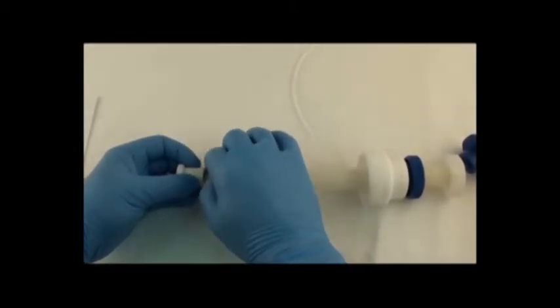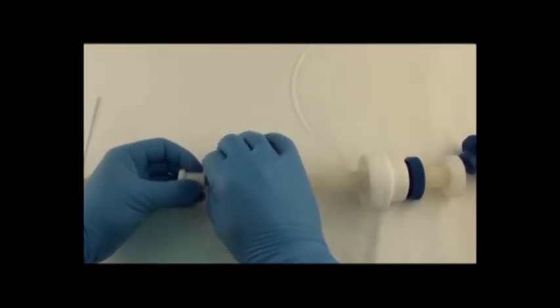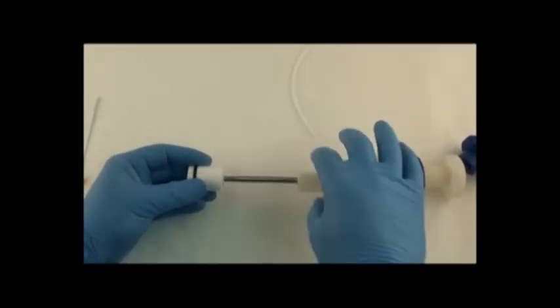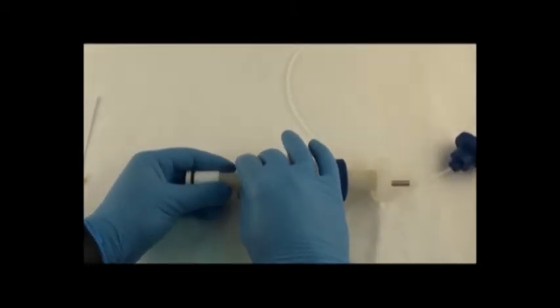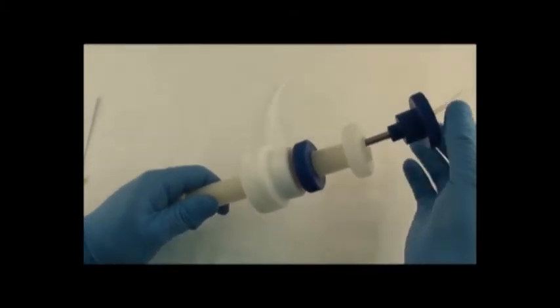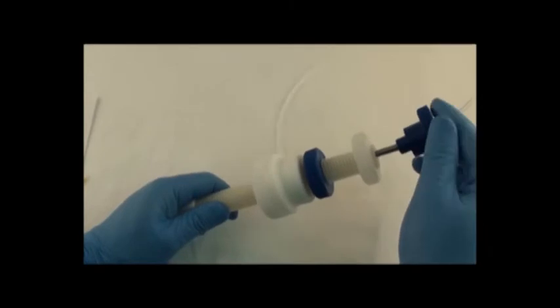And then this locking fitting is tightened. Again just finger tight. Put the o-ring and the collar in place. Slide down the threaded rod and then screw the top knob back on while I'm holding the end fitting.